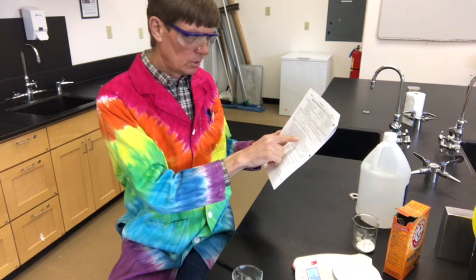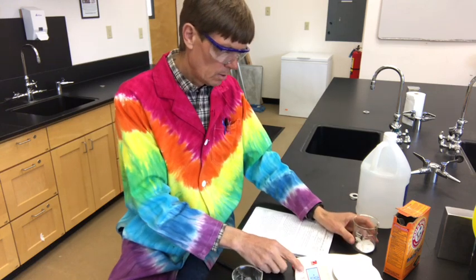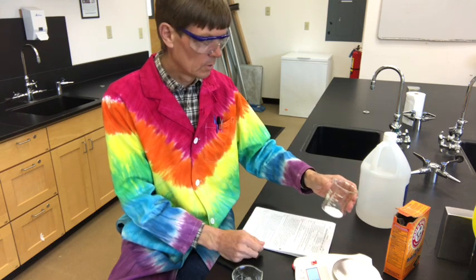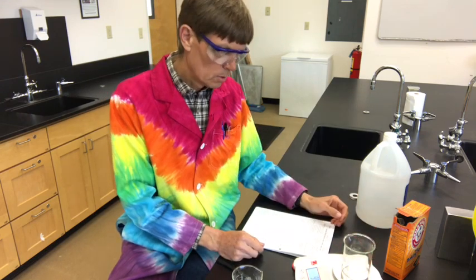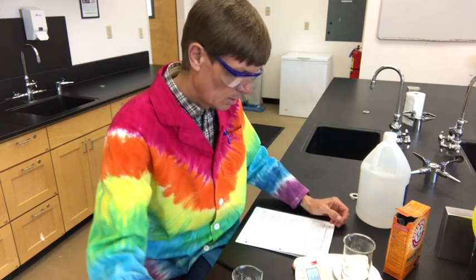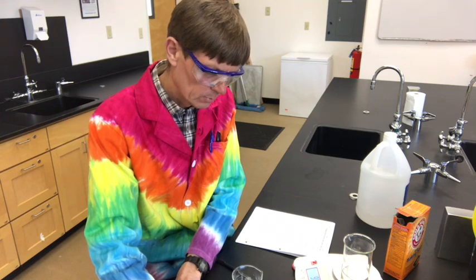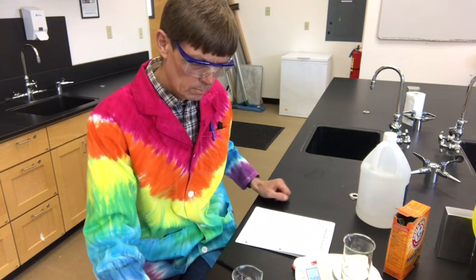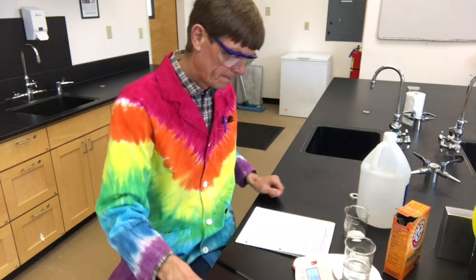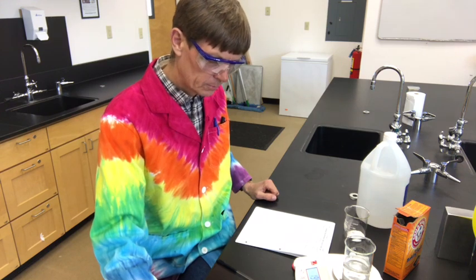measure the mass of each of these beakers. So you've got some blanks here. I want you to put in here the mass of each beaker, because we're going to look at how much mass we started with and how much mass we're going to end with. So this beaker is 96.45 grams. And then this other beaker is 194.65.